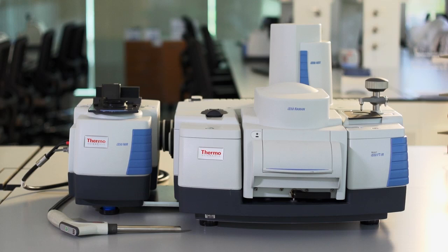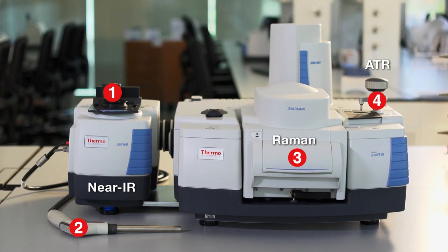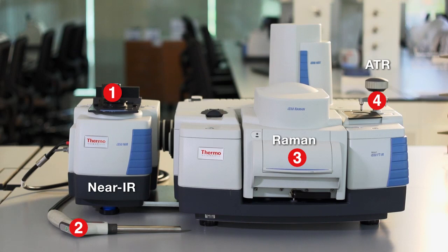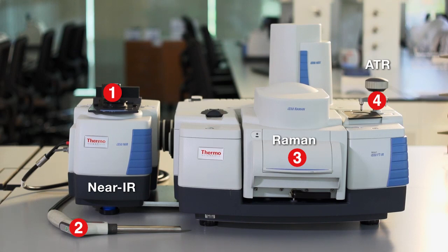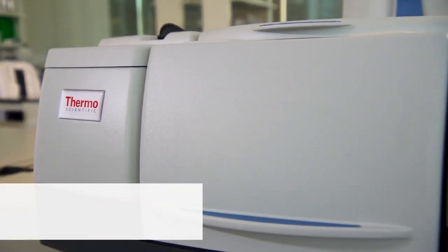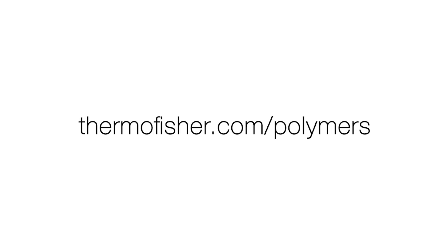Integrating three multi-range techniques and four ready-to-use sampling stations, the Nicolet IS-50 spectrometer provides a new dimension in efficiency for measuring polymers, blends, compounded plastics, rubbers, and resins. The Nicolet IS-50 materials analysis workstation — Smarter FTIR. Easily done better. Learn more about the Nicolet IS-50 at thermofisher.com/IS-50 or about all Thermo Fisher Scientific solutions in polymers at thermofisher.com/polymers.